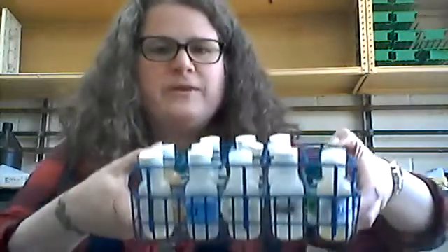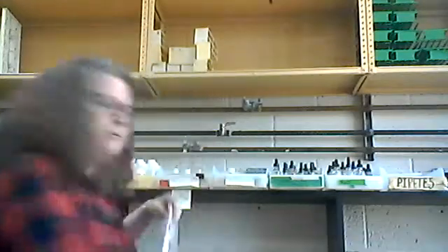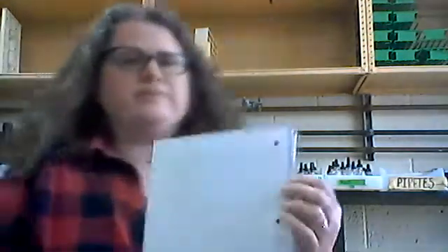Hi there, Dr. Tucker back again. This week we're going to talk about amino acids and we're going to do a couple of procedures just to investigate different properties of amino acids. So we have all these different amino acids that we're going to look at. I'll show you the list of them and I'll post this on Canvas also.